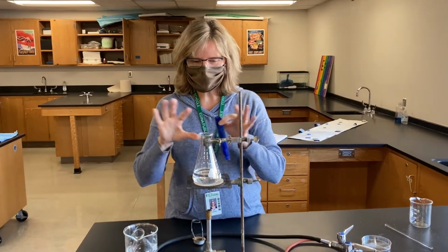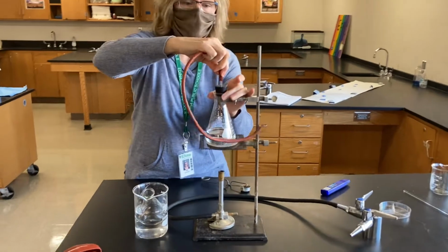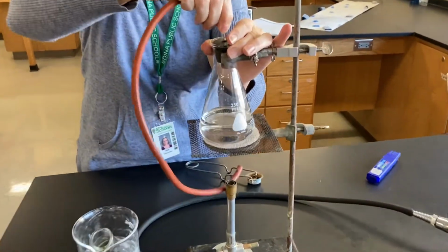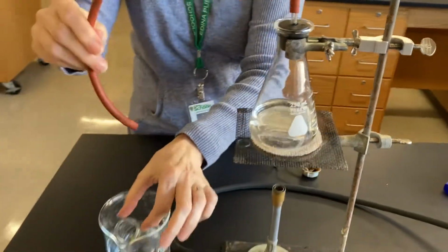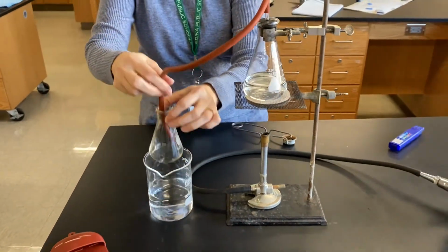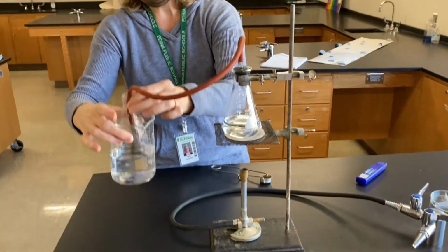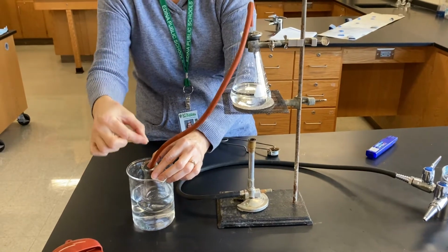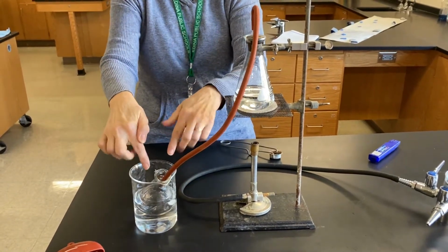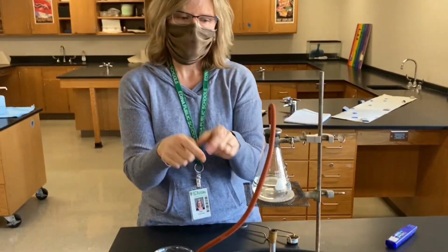So we're going to set this all up. The way that we do that is take this stopper, put it in here so that the gas doesn't escape as it evaporates. And then we'll put the other end of this tube into this empty flask. And it's sitting in this cold water so that as the gas goes through the tube, it will land in this other flask and cool down. So that'll help it condense.